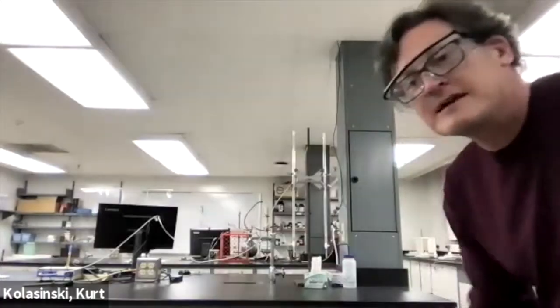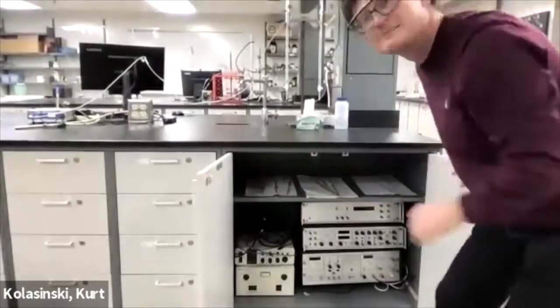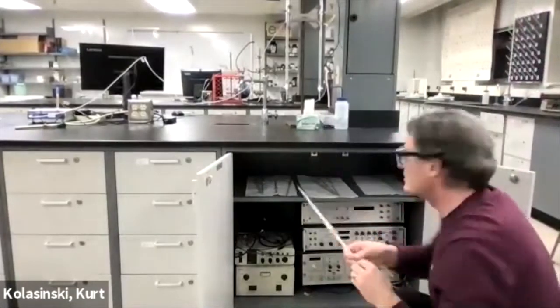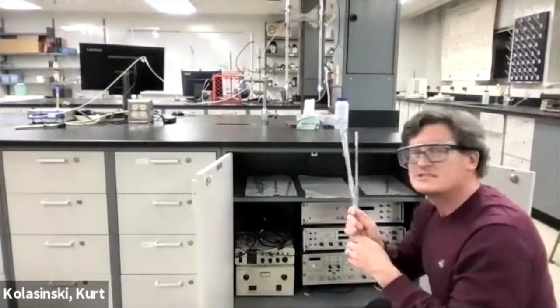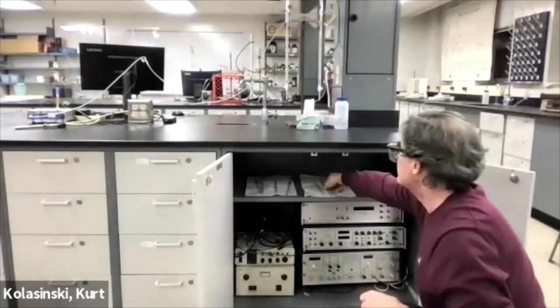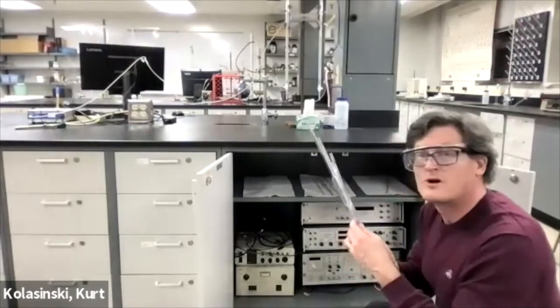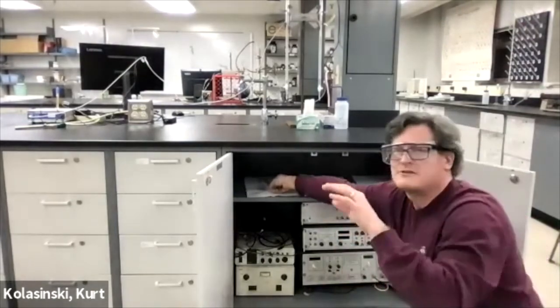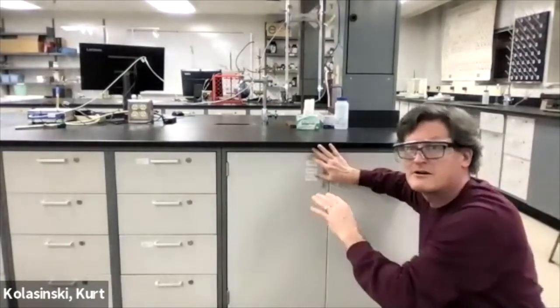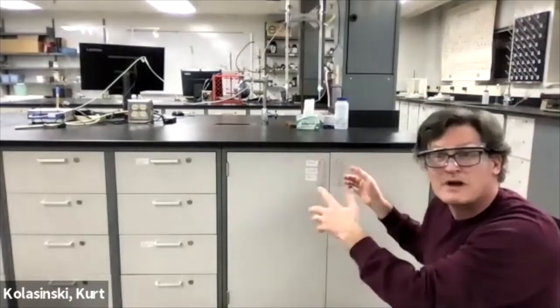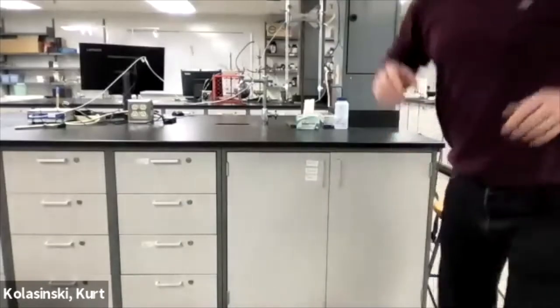What I did special for this is I've got some pipettes—one just for the fluorescein, a set that are just for the KI plus KOH, and a set that are just for the KOH solutions. You don't want any cross-contamination. So that's one measure we're going to take there. We're going to get those in the right sizes so we have a minimal amount of pipetting that we have to do.